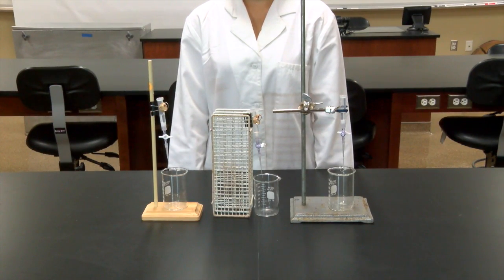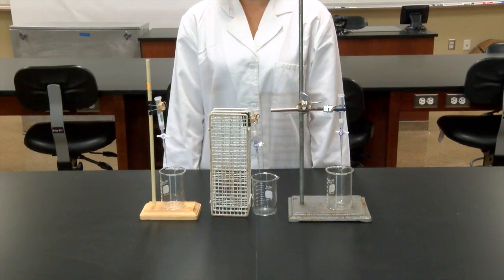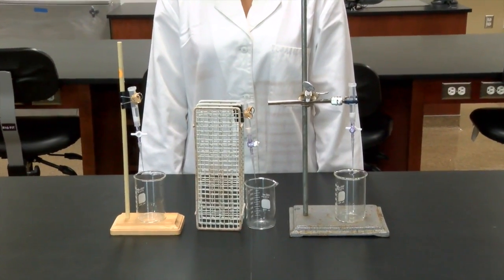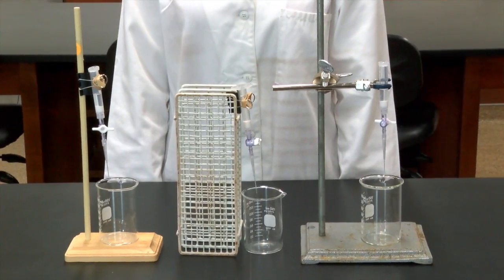Each group should place their column on a vertical stand, high enough so that the column can drain into a waste beaker or cup. Depending on what your distribution center or school supplies, your standard setup may vary from what is shown here.